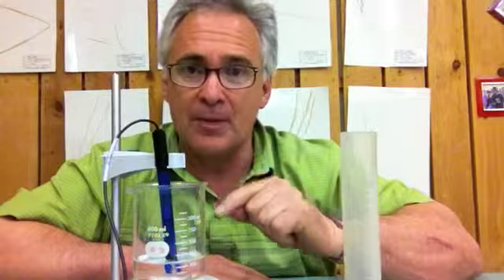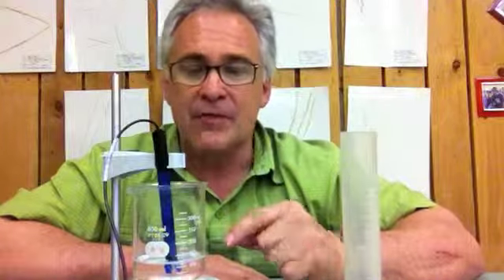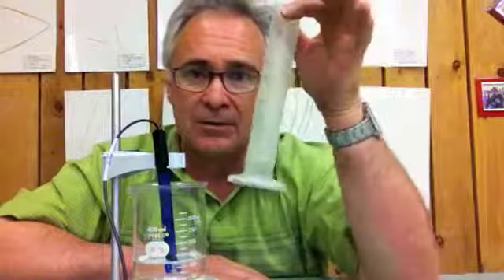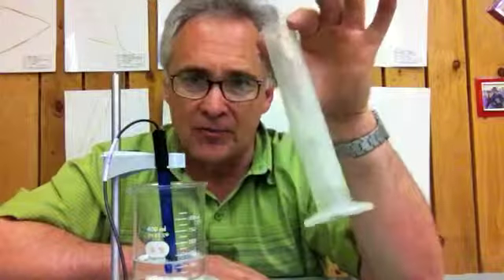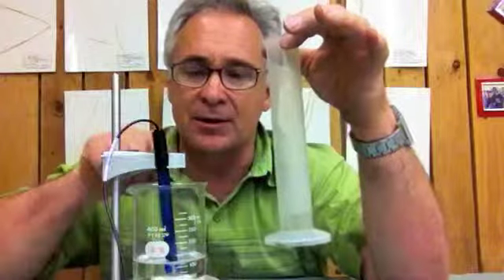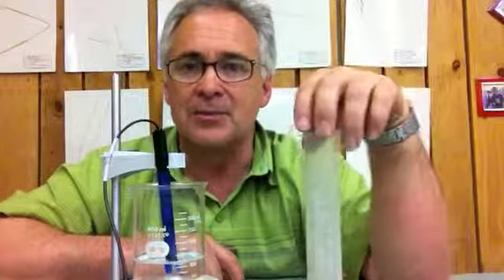Now, please remember, you're comparing water's ability to act as a buffer versus club soda. Remember, the thing that we're adding that's constant is the vinegar. Vinegar has a certain kind of pH, and I'm not going to tell you what it is, and we're going to see which one of these substances, club soda or water, has the best buffering capacity of the two. So please make sure you snapshot or save all of your graphs as you do them, because that's going to be really important in the analysis. All right? So we'll be getting back to you on the other side of this lab.